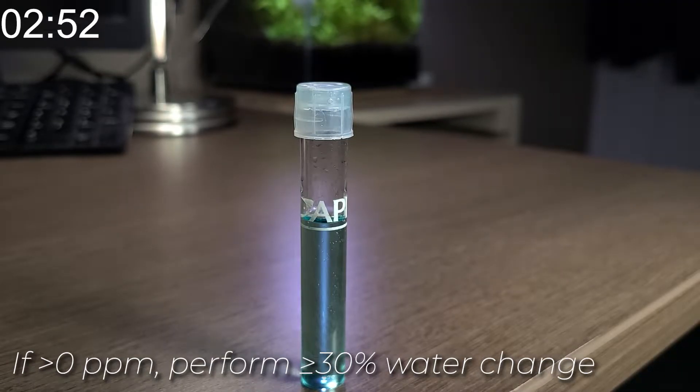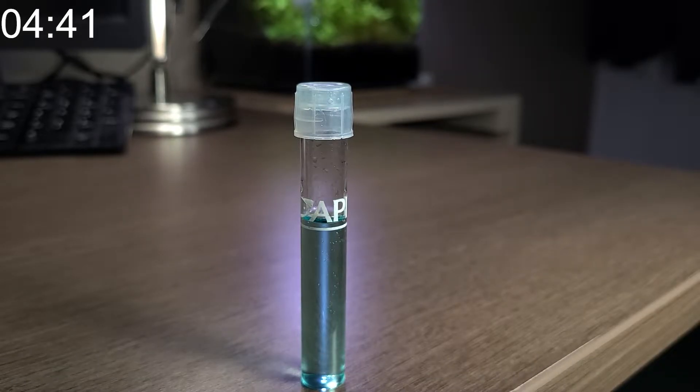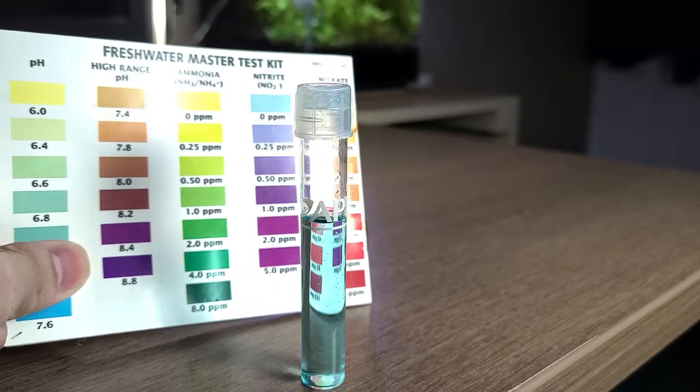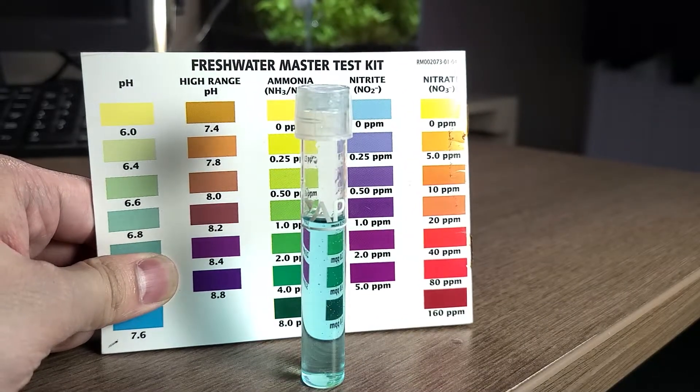If it's higher than zero, please perform a 30% or more water change to remove some of it. Here we have zero ppm of nitrite.